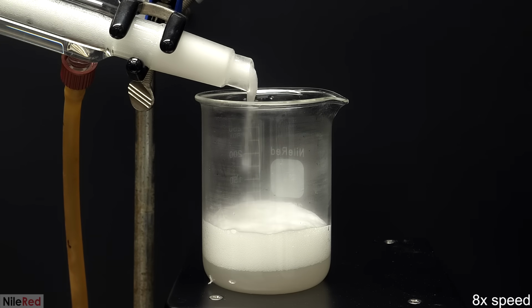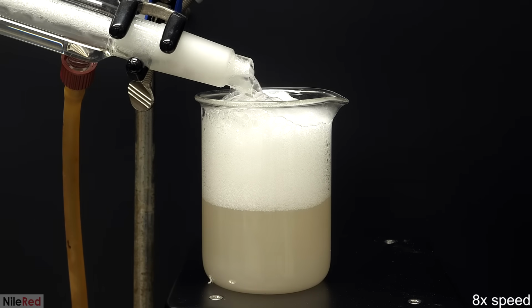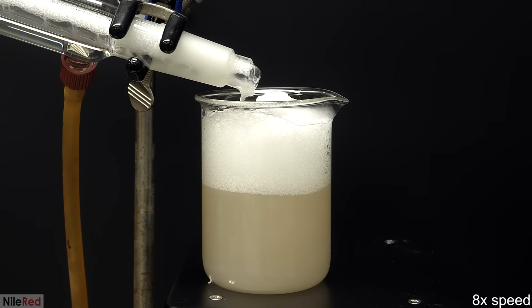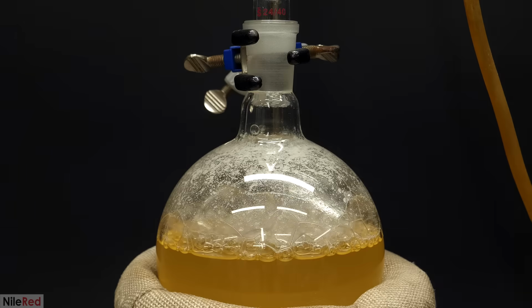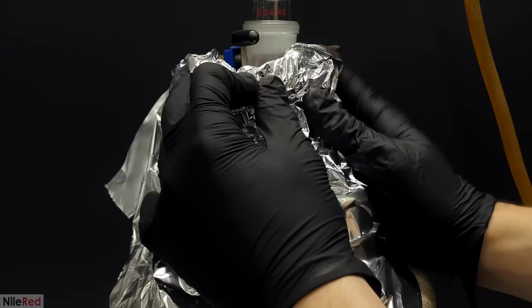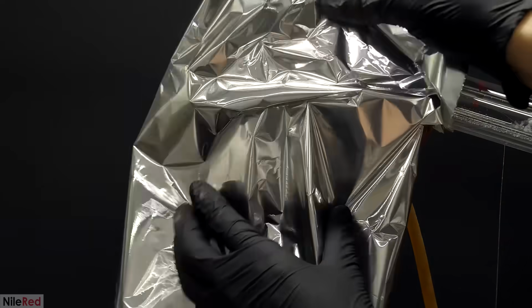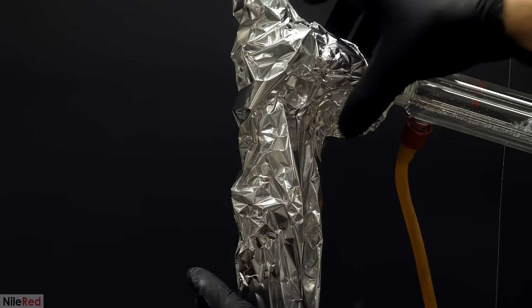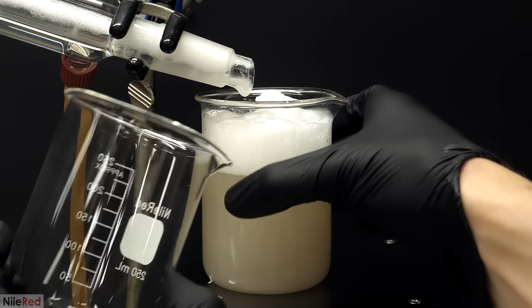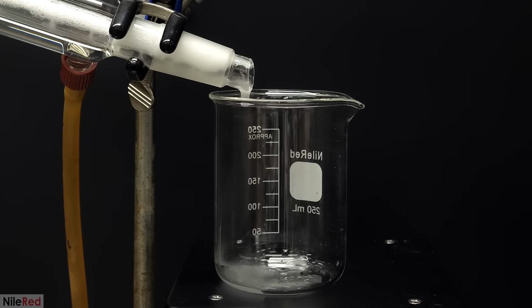This was a bit of a pain, but it wasn't the end of the world. It just meant that it was going to take a bit longer, because I now had to recycle everything here in the next batch, and also, I had to be a bit more careful with the heating. When it eventually looked like it was under control, I covered the flask and the column with some aluminum foil. This helps insulate them, and it makes it easier for the vapor to climb the column and make it to the condenser. I also swapped the beaker, but the stuff coming over was still pretty murky because it was picking up all the solid junk that was carried up the column before.